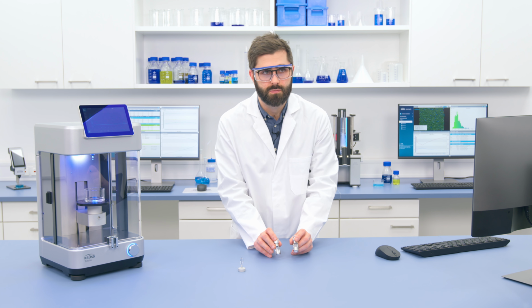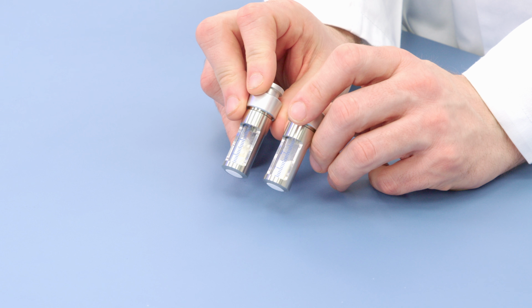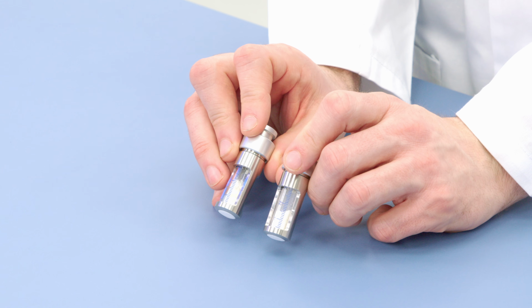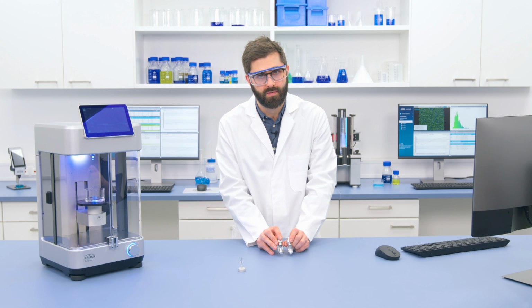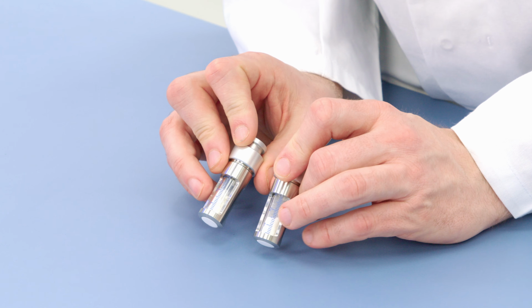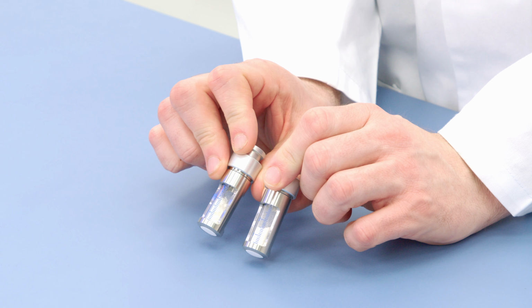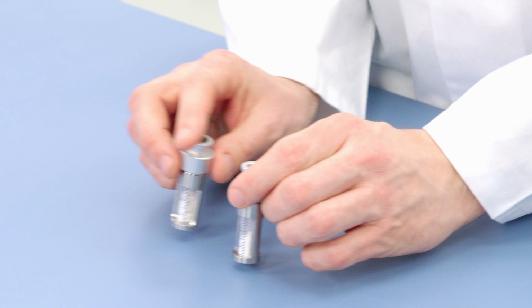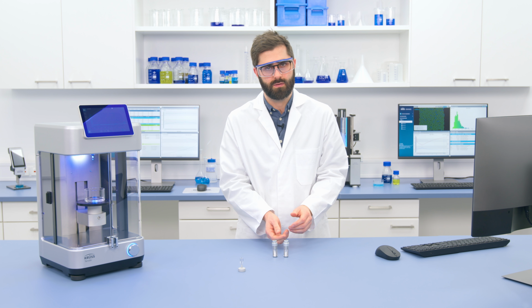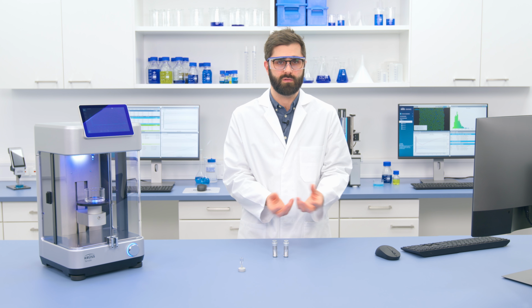So now that I've got my two samples, I'm almost ready to start measuring. But one thing I need to check first is if my samples are really prepared in the same way. So we're already careful to make sure we have very much the same mass of cellulose inside. But if we look at the side through this window, we can see the level, the height to which the cellulose rises inside is a bit different. And that's because even though I've filled in the same amount of cellulose, the amount of compression of those cellulose particles is a bit different.